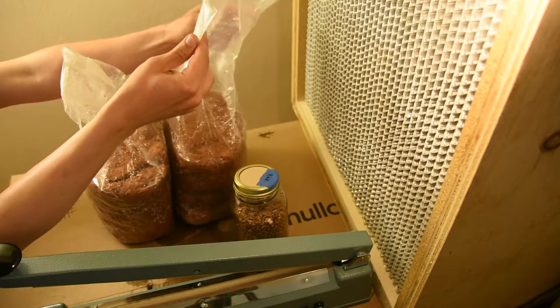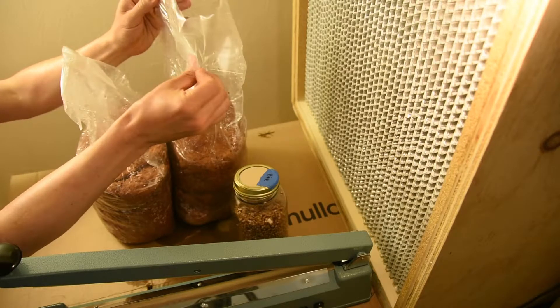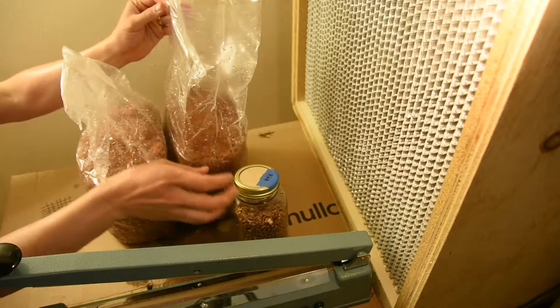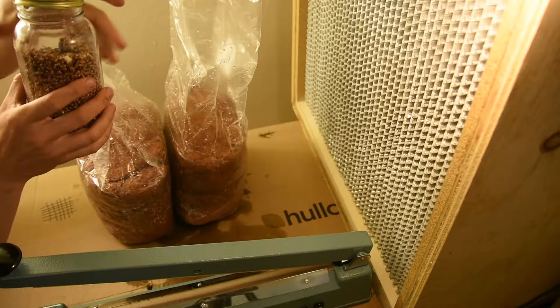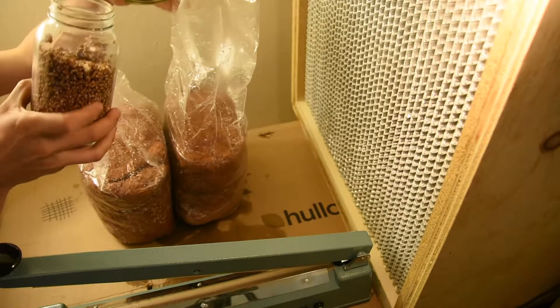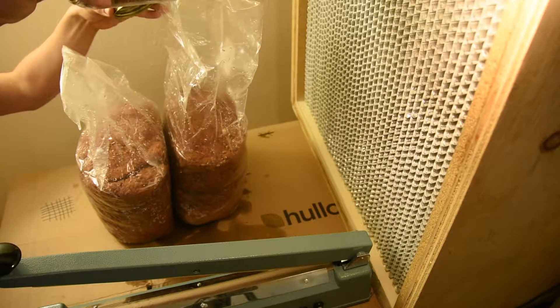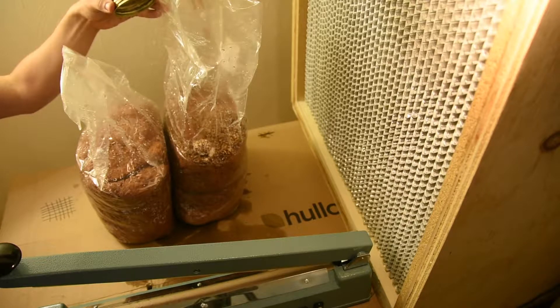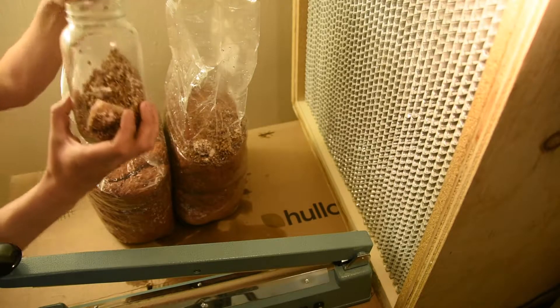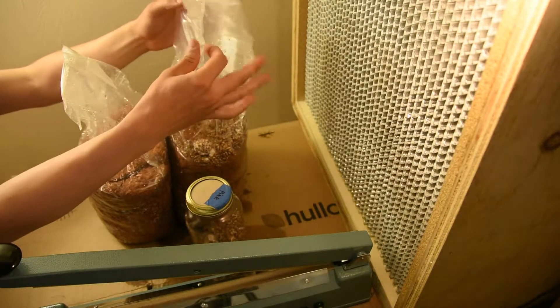I'm making sure that I never touch the inside of the bag, so I'm going to open it carefully and slowly. I don't want to rapidly suck air in, even though I'm using a flow hood. I want to reduce the amount of air that I'm sucking in and the disturbance that's happening. I am holding my jar horizontally, rolling it with a half turn on my wrist, just allowing the grains to fall out. I'm not shaking them, not dumping them — allowing them to roll with a very gentle left-right half turn on my wrist so as to not disturb skin cells or the air in general.